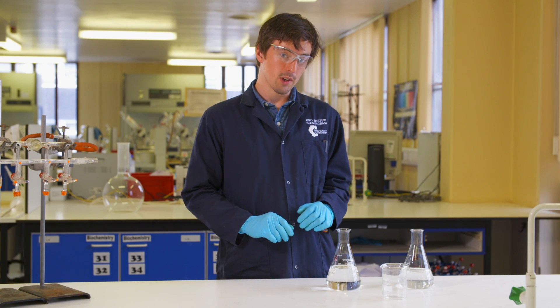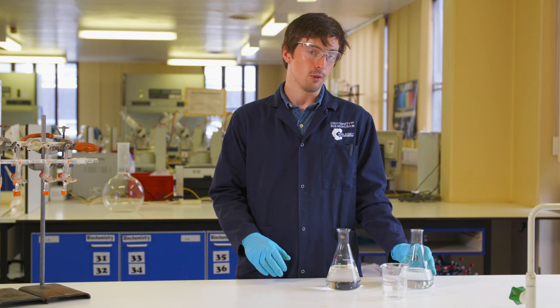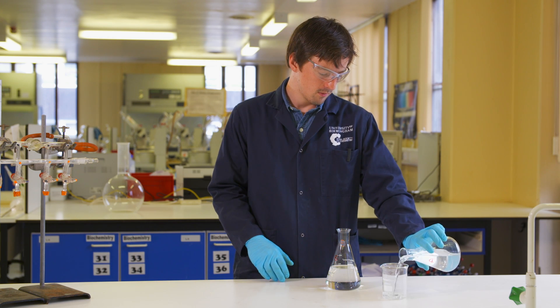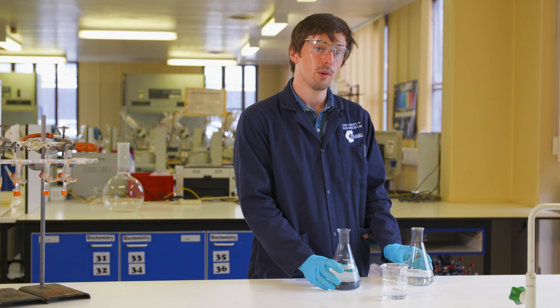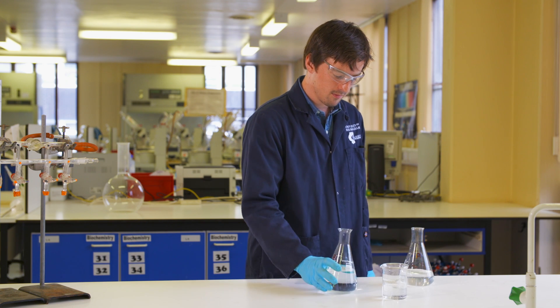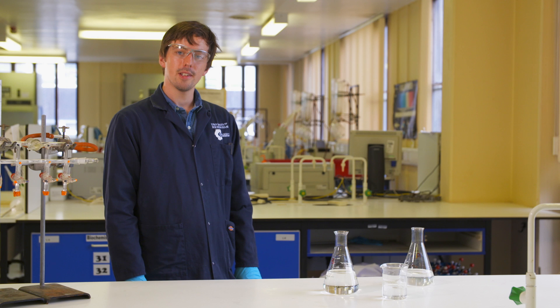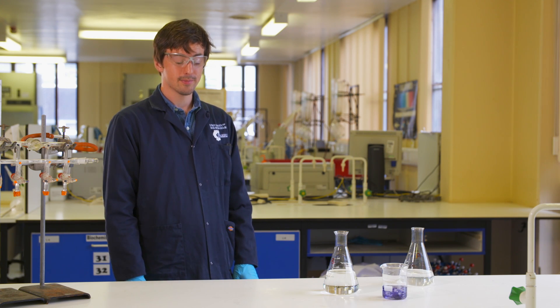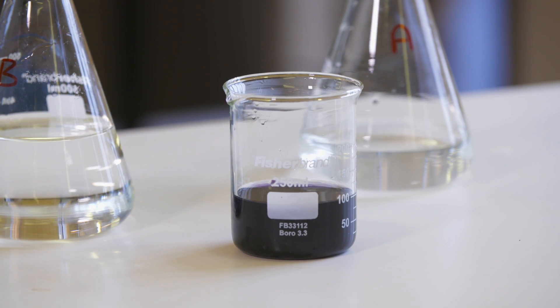Let's see what happens with this reaction. I've got a solution of potassium iodide, sodium thiosulfate and starch. I'm going to add a little bit of hydrogen peroxide with a splash of acid. Oh, nothing happened — that's a shame. Maybe it's slow. The colour changed really suddenly! We can time this reaction really easily since there's a well-defined end point.